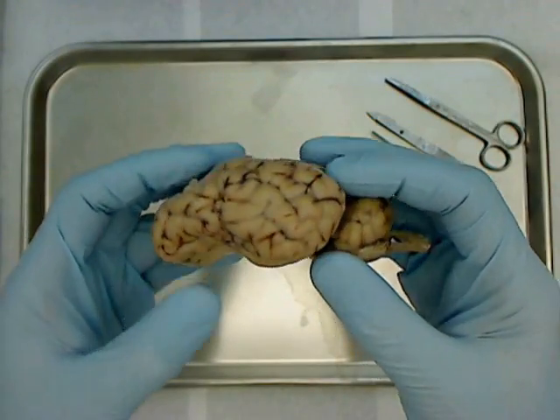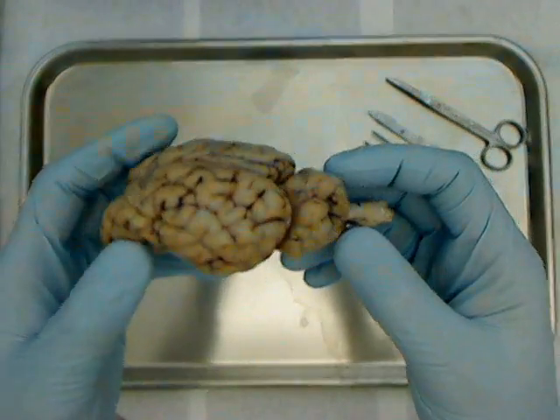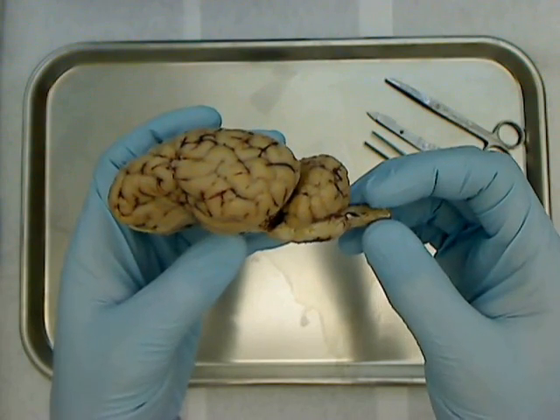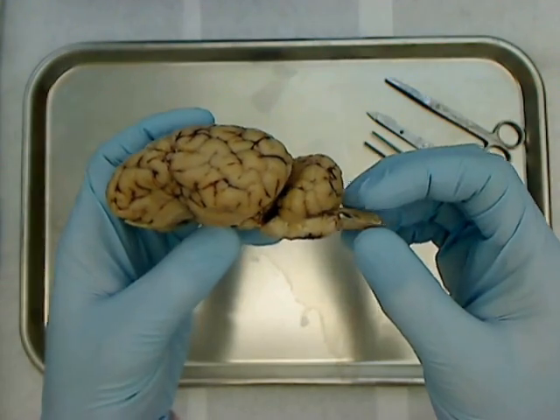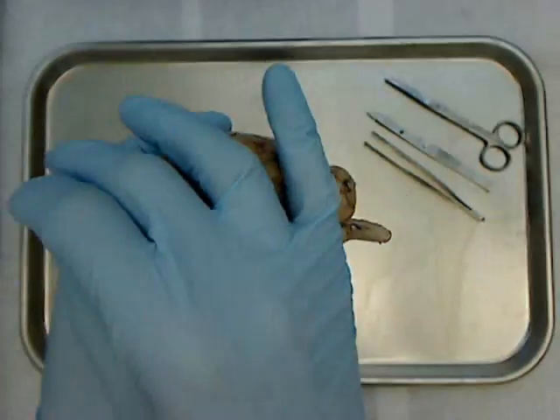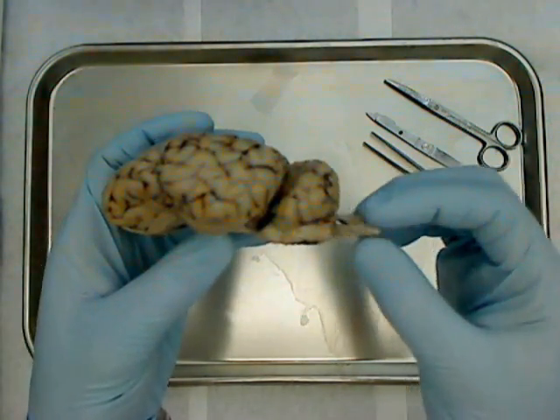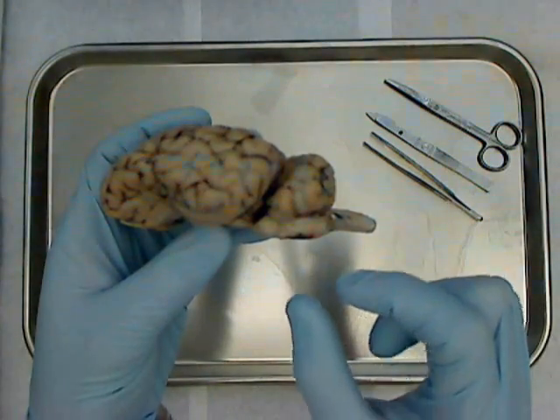This, of course, is the sheep brain. Notice, in terms of species differences, because the sheep's body — because they're four-legged animals — their spine lines straight up with their head towards their eyes. So the spinal cord, which is back here, comes out straight back. Whereas in the human brain, the spinal cord comes downward.